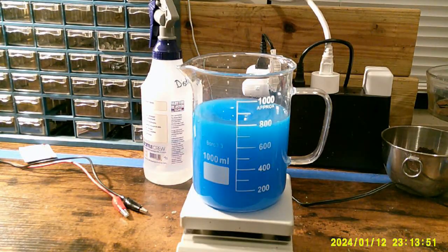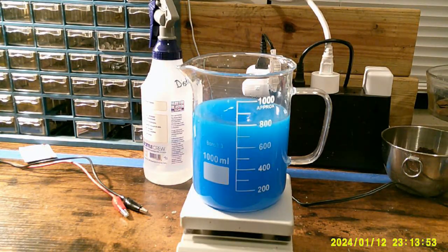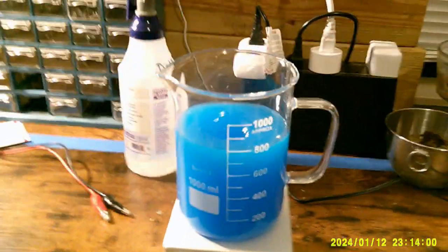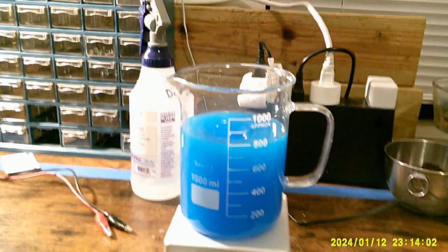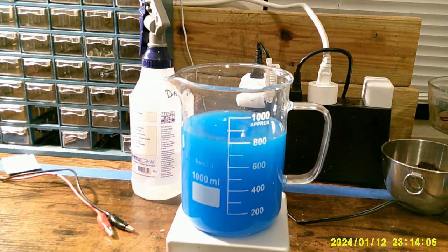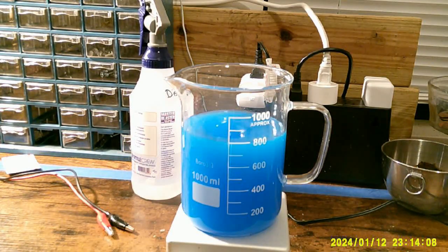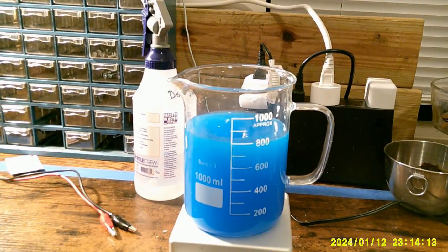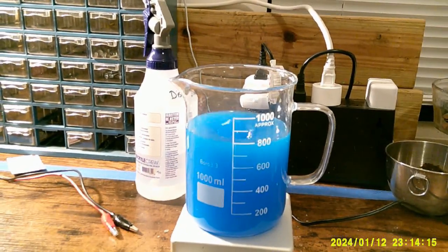And there we go. Let's see if you can get a good view of this. It is stirring. Now it usually takes about five minutes of stirring. So while that stirs, I'm going to show you the setup I'm going to be using.